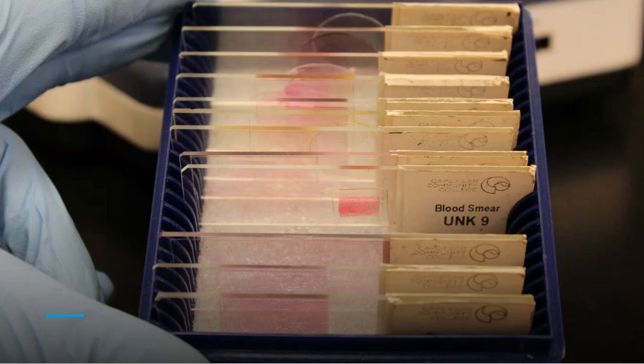When you walk into the lab, you're going to find a box of microscope slides. It might not be in a box like this, that is a blue box at least, but it will be something similar. You'll see some slides on the inside. They'll be labeled. It will say blood smear unknown 1 through whatever. And then what we've done, like I've said in the previous video that you watched, is that we have tried to write top on the top side of the slide for you. We don't want your fingers all over these slides to kind of feel around where those samples might be.